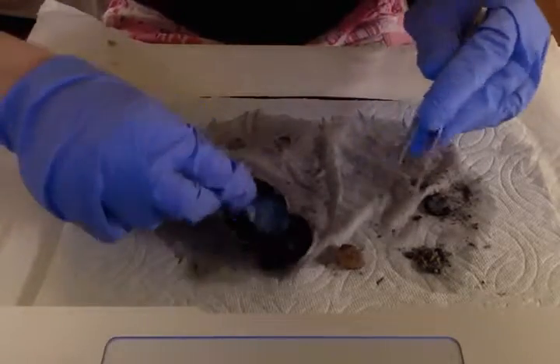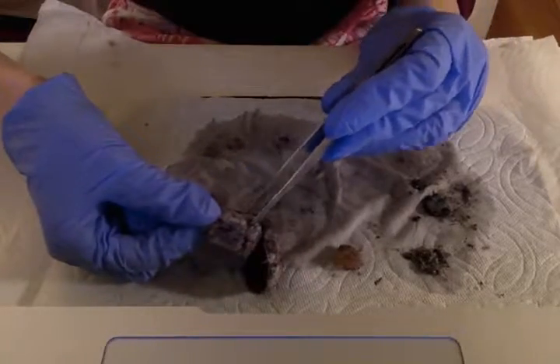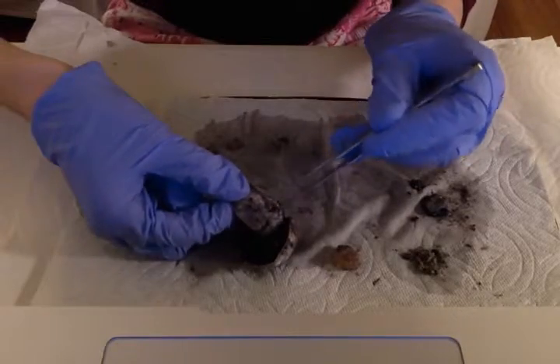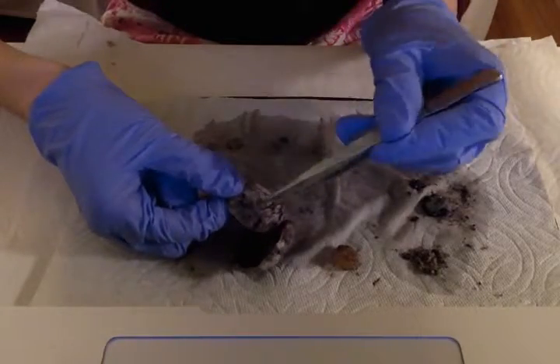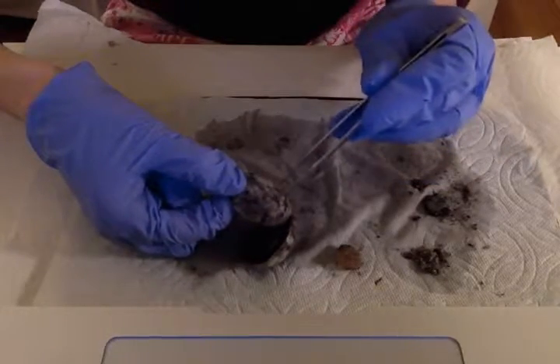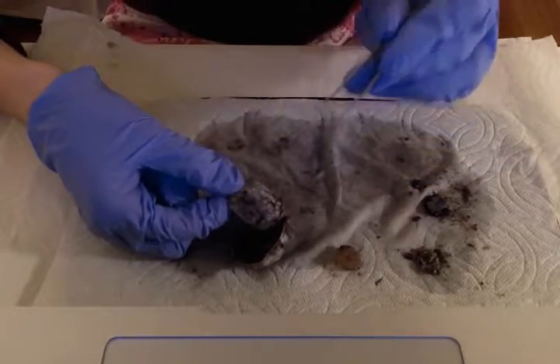Now, the optic nerve, I'm just going to flip this over, and I'm pulling it up right here. You might not be able to see, but it does really stick out in my dissection. I saw it literally immediately before I cut any tissue away. It's right there. I'm wiggling it. Now, the optic nerve connects the eye to the brain.